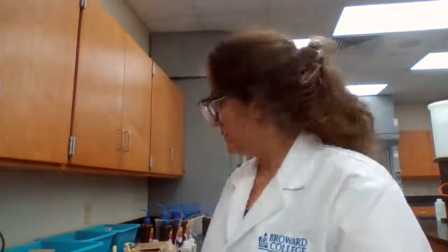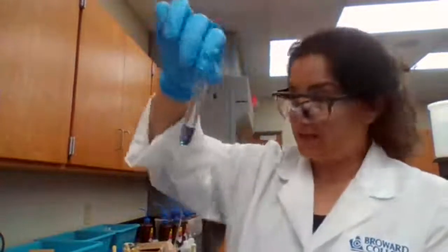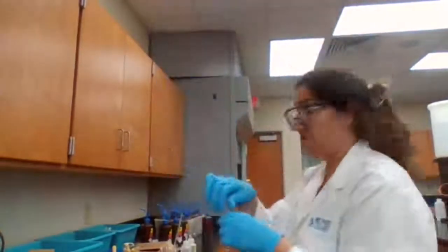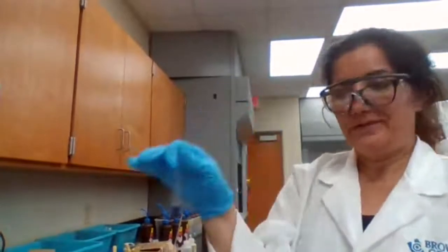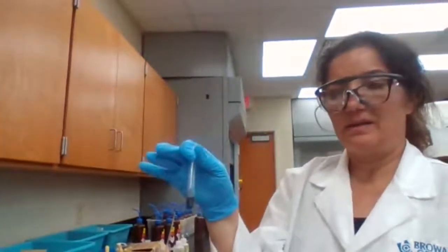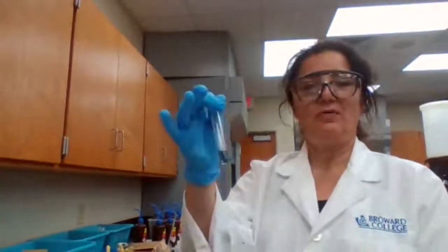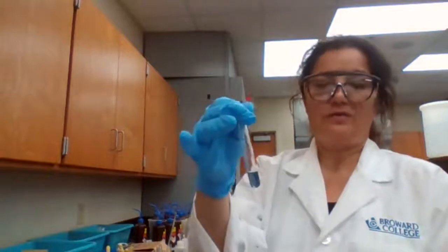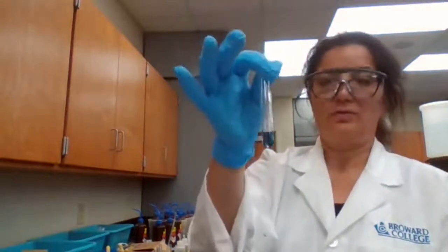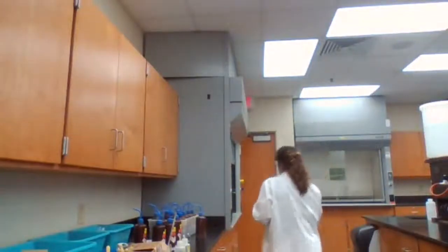I'm moving to part D, to the first test tube, adding KSCN following the procedure. Because if you were in the lab, you would do the same procedure you followed for the known sample, with the exception that you don't know which one is going to be positive and which one is going to be negative, and you have to wait for the result and just record your observation. So you're going to add KSCN.